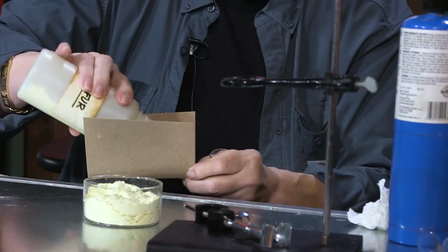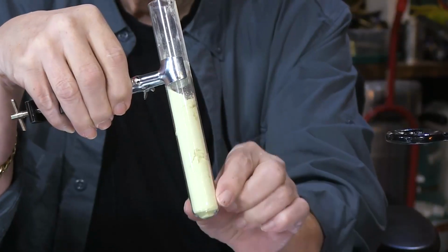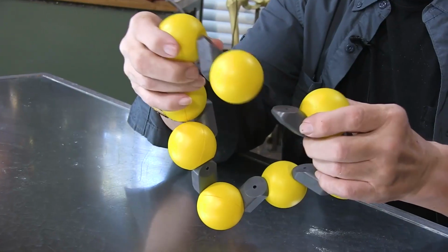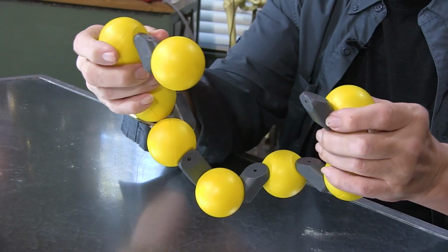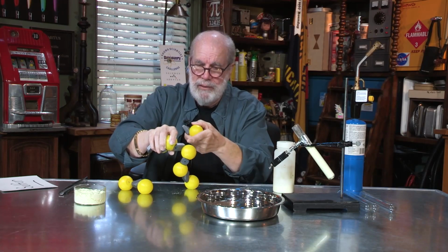And what I did was I filled this test tube with some S8 sulfur. And in order to make an artificial booger, I had to take these atoms apart. How in the world could you make them split apart? Now, if I take this model right here and start shaking it, eventually it's going to fall apart like that. So if I can get this molecule to shake hard enough, it's going to bust apart. The bonds between them are going to break.